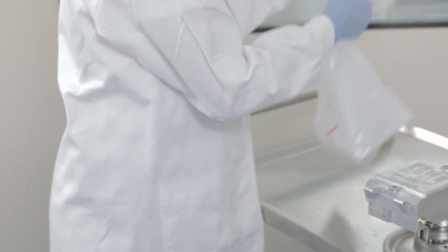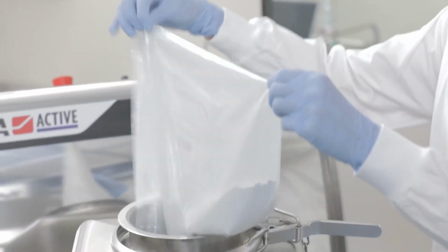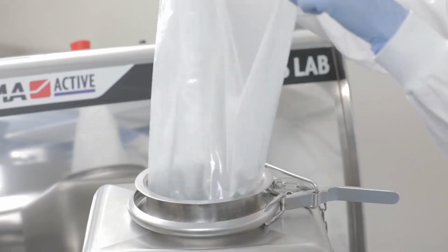The philosophy behind the application of NIR spectroscopy to the bin blender is to use the NIR spectrum as a sort of fingerprint. In this specific case, we are mixing 2 ingredients, lactose and talc. Before adding the ingredient to the bin, we have recorded the NIR spectra. The gravity sensor embedded in the PAT-W and WX allows us to acquire a spectrum every rotation. In the beginning, the spectra will be for sure different, and afterward they will become more and more constant.